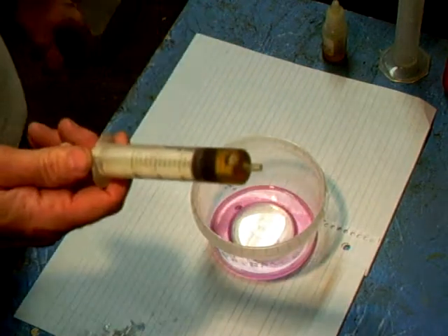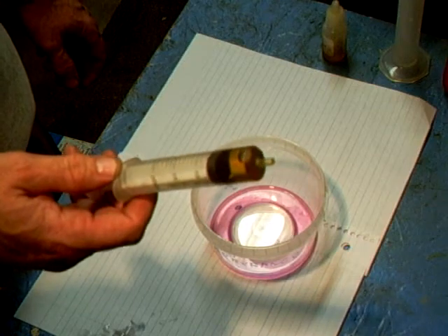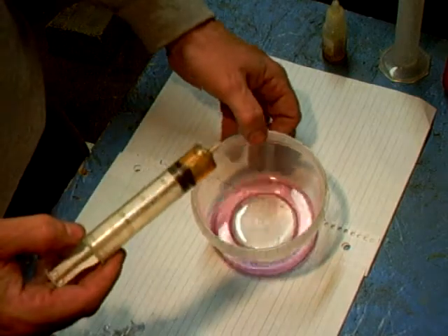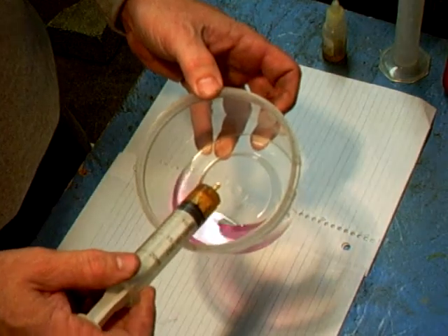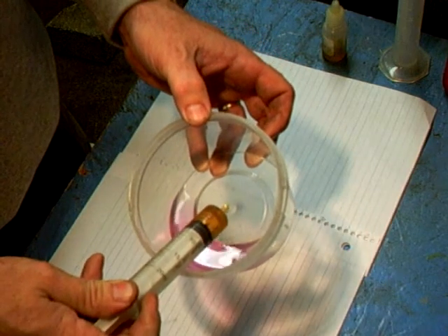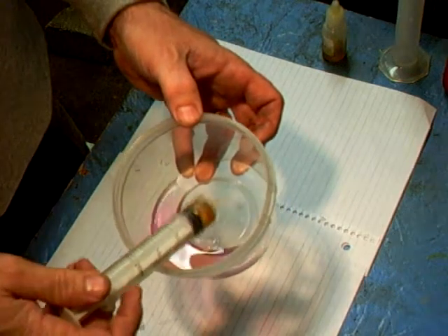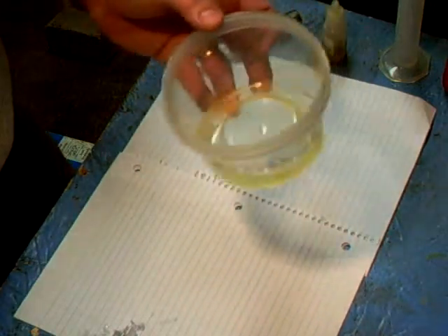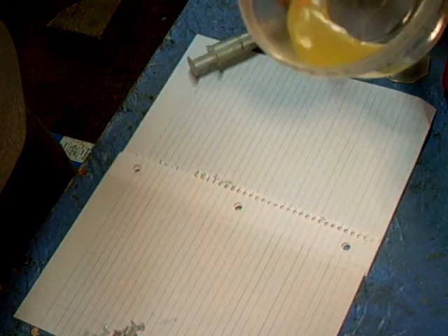Next, we have our used vegetable oil. We're going to put in two milliliters of this. I drew in about five just so I know I had enough. We'll squirt in about two. There's two milliliters. Mix that up, and it turned kind of yellowish.